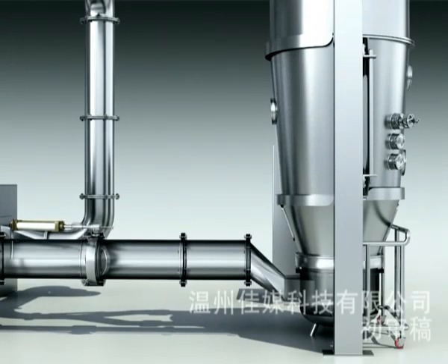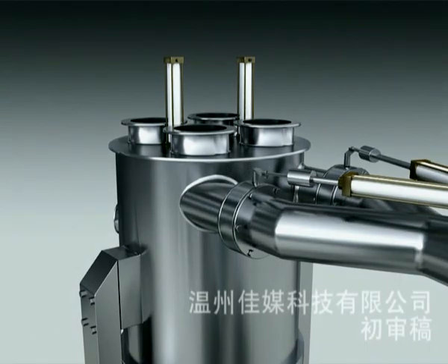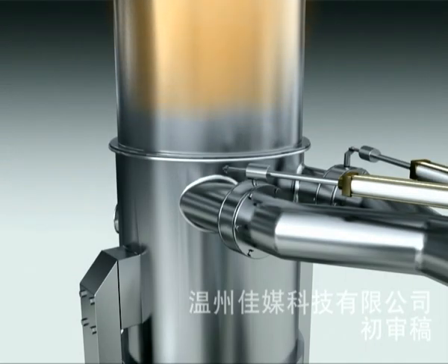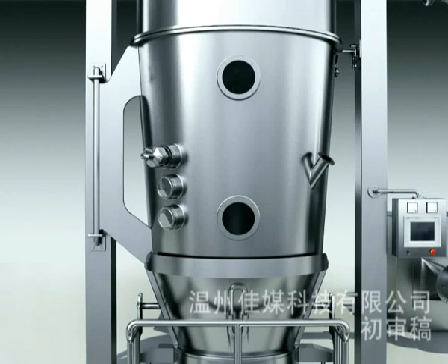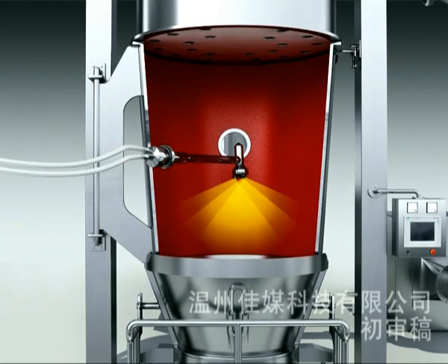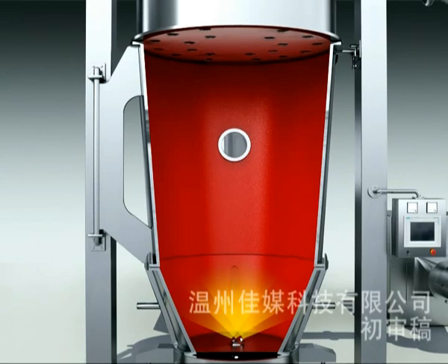The automatic valves on the air inlet and exhaust ducts will also close automatically so as to protect the air inlet handler and the exhaust fan and filter. 1. Please consider the layout of the explosion release ducts for explosion-proof type. 2. WIP system is available on request. 3. Vacuum feeding arrangements are available on request. 4. Integration of top spray granulation, bottom spray coating, also known as Wurster inserts, and tangent spray for pellet making are available on request.